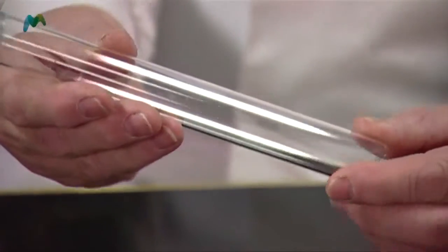We need to sterilize some forceps — they're often used for moving small things around in microbiology. If you've got some little sterile paper discs and you want to move them from one thing to another, then we need to use these forceps, and so what we need to do is to sterilize them in a boiling tube like this.